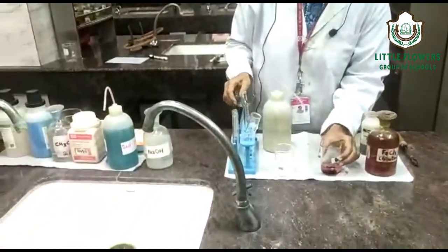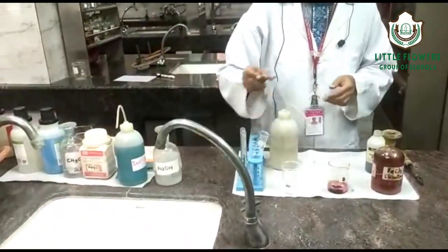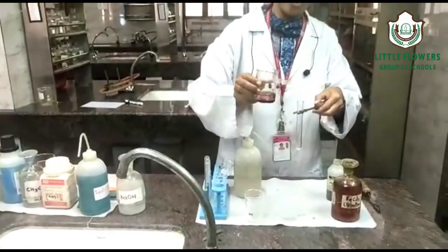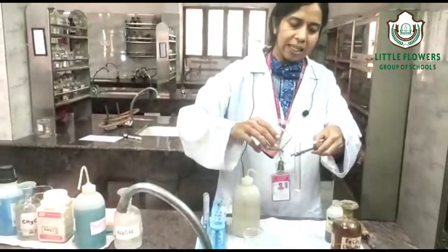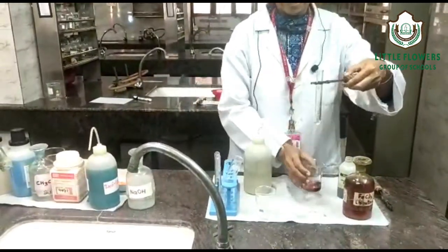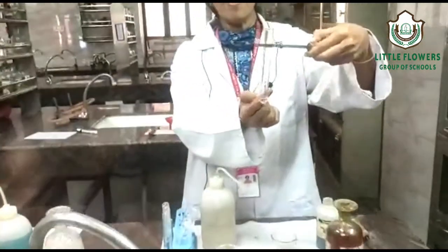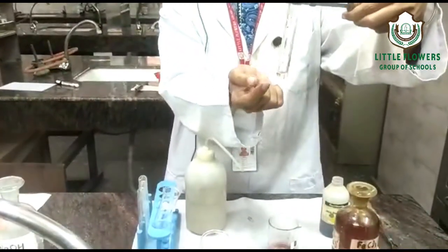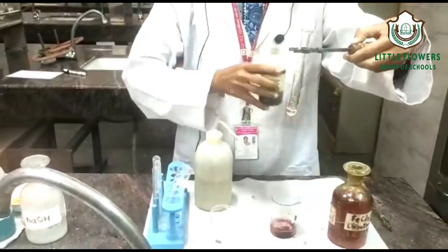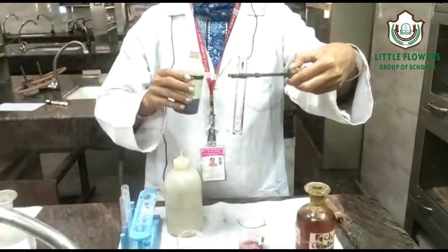After odor, we will check the nature of this organic compound. For that, we take a few ml of organic compound B in a test tube. I will show the test tube — you can see it is a colorless liquid. We are checking the nature of this organic compound.